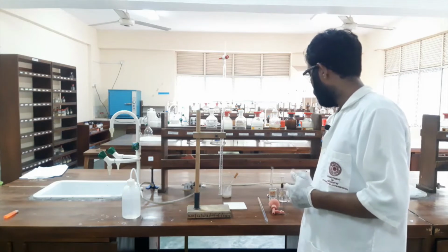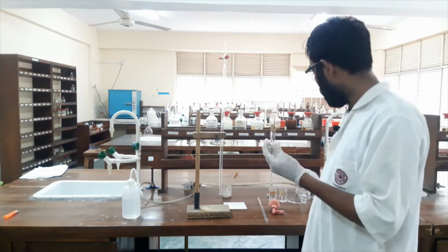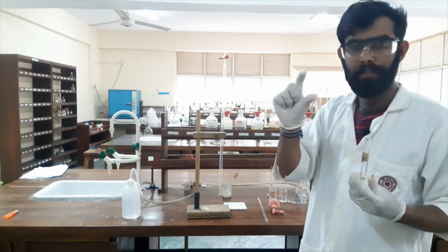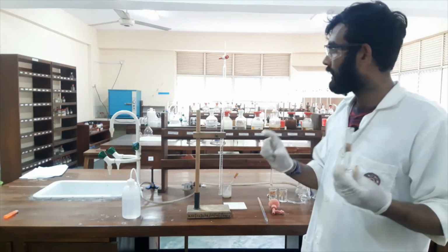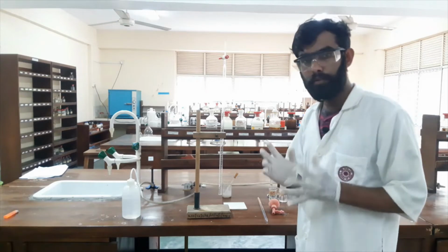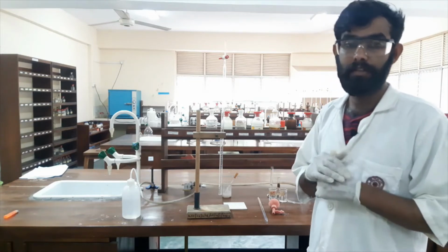Okay. After that, here I have 5 milliliters of potassium iodide. When I mix this potassium iodide and the copper sulfate solution, the copper 2+ solution, iodine will be trapped due to this excess potassium iodide, and that iodine I will react with sodium thiosulfate. I will explain every step. Please remain with me and carefully look at what I am doing and what the necessary steps are.